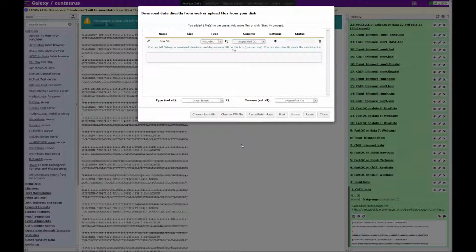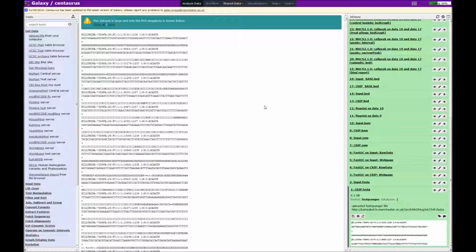There is actually a fourth way of getting data into Galaxy, and this is by uploading data to an FTP server and configuring Galaxy to import data files from that FTP server.